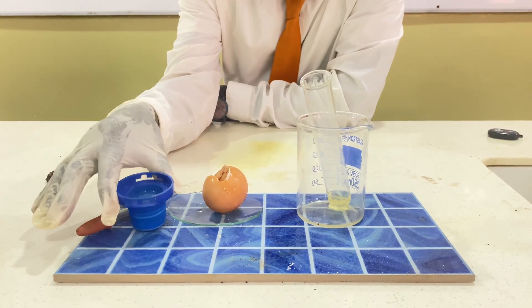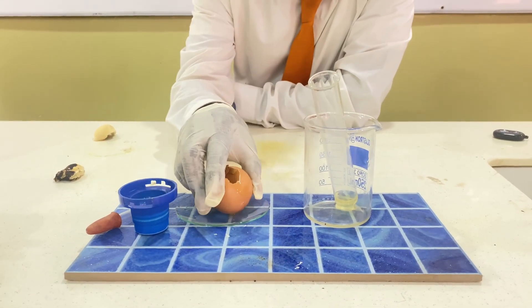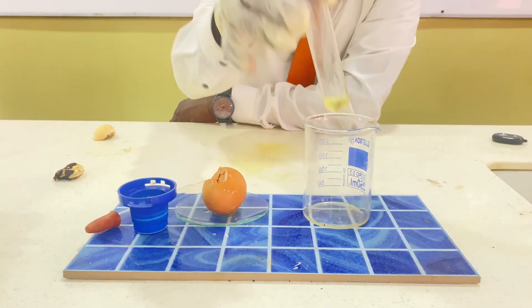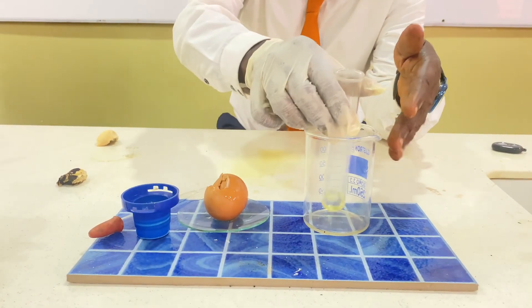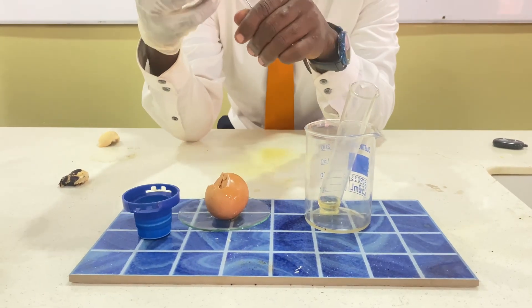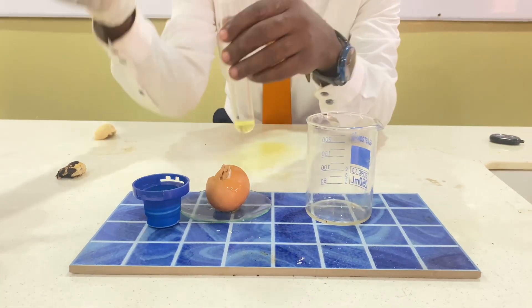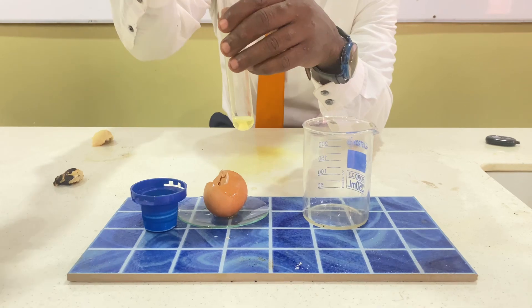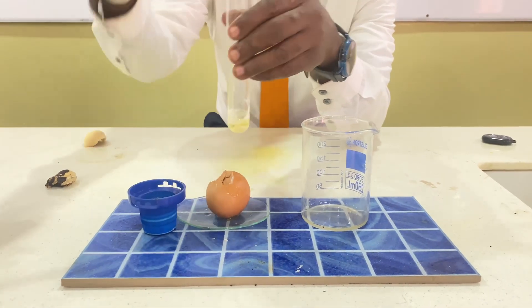Millon's reagent is here, and we have our egg here. We are going to use the egg white — the egg albumin — and not the yolk. The egg white is placed in this test tube, supported by a beaker. You take your dropper, then take a sample of Millon's reagent and add a drop into the egg white, as I am doing now.